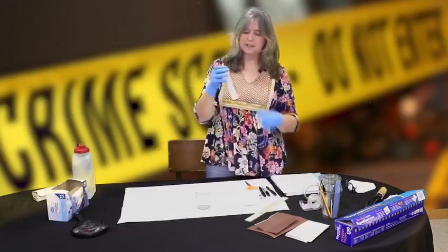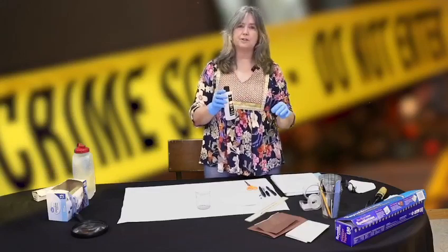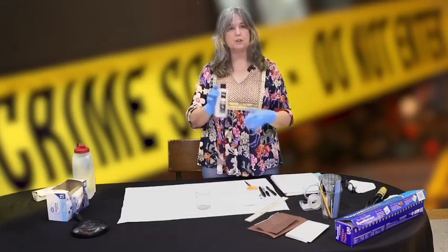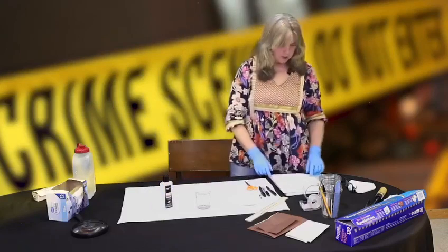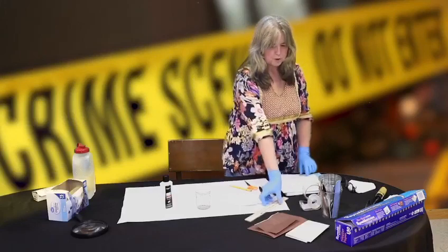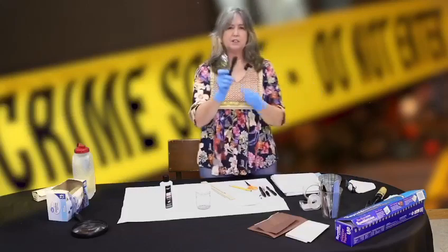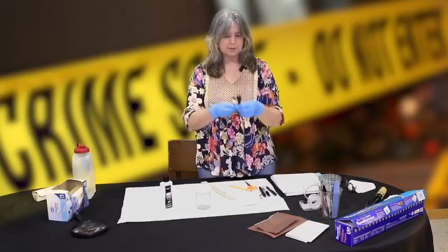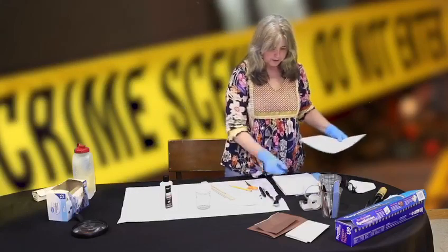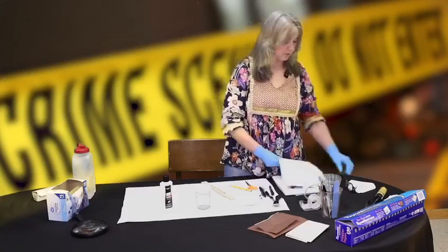What you want to be careful with is that acetone is a solvent and you don't want to get it on any painted surfaces or finished wood because it'll start to dissolve them. So be a little careful with your acetone. We also want a pencil and some sort of straight edge — I have a ruler here — plus a one-teaspoon measuring spoon. And you want to have your notebook and a pen to write down notes to keep track of what you're doing.